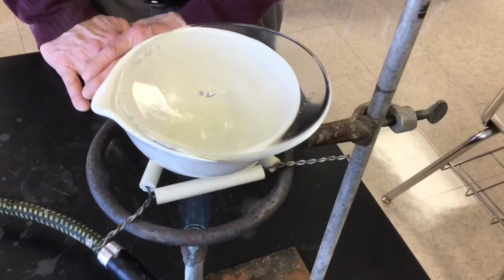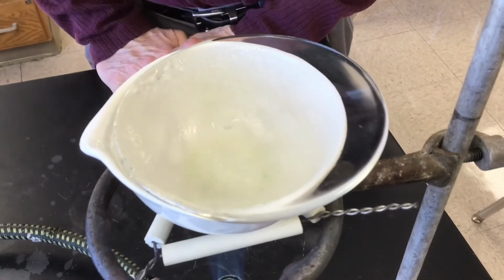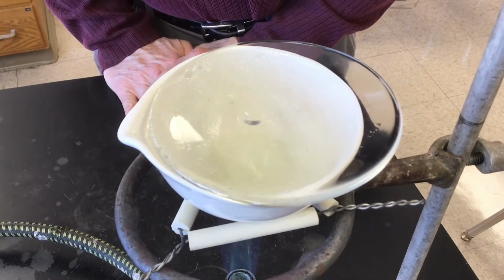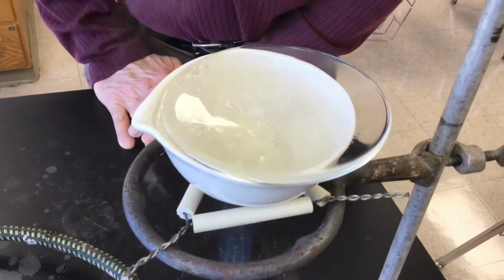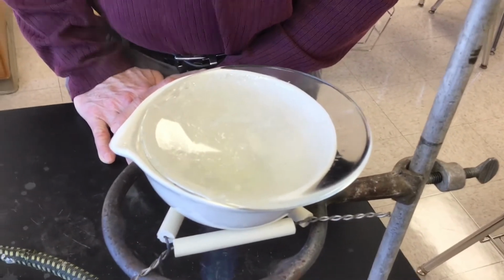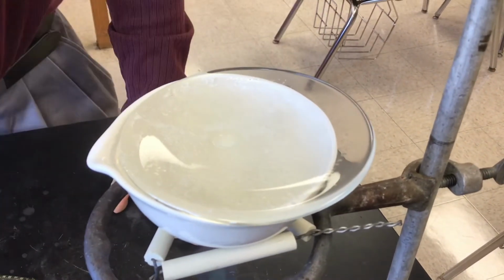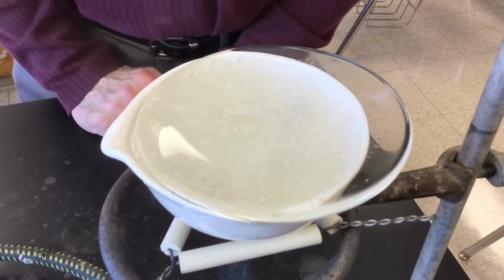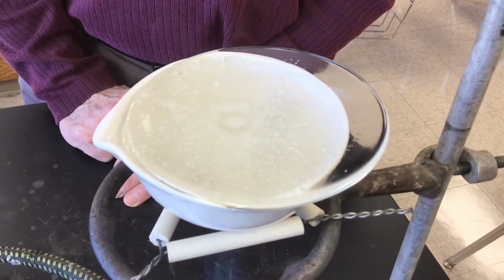We've let this go a couple of minutes, 3 minutes maybe, and it's winding down now. You can see it is bubbling vigorously. Now the instructions will say that we heat this until the last water to go is on the watch glass. You can see there's a drip of water on the watch glass, and you can hear that crackling. The water's pretty well gone now. It's almost gone. We're going to watch that watch glass, though. That's the last thing to go dry.